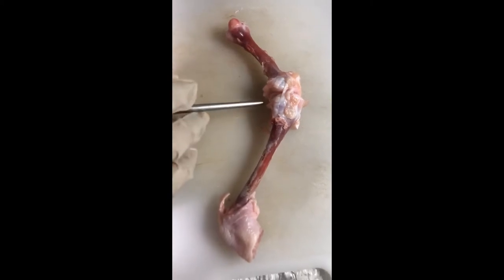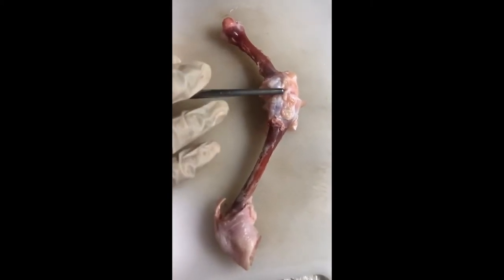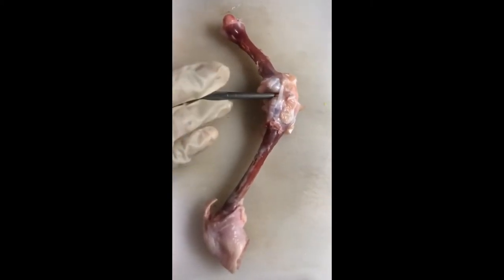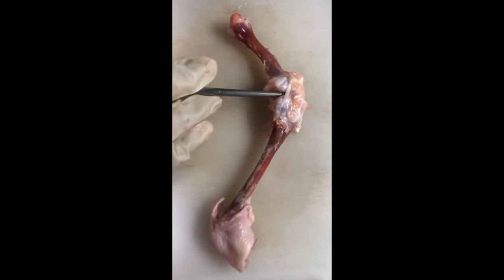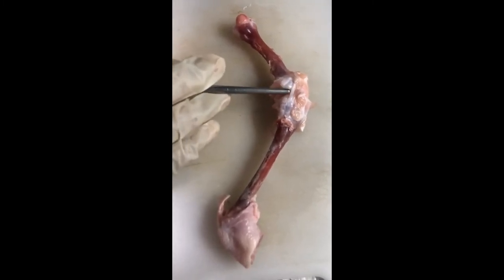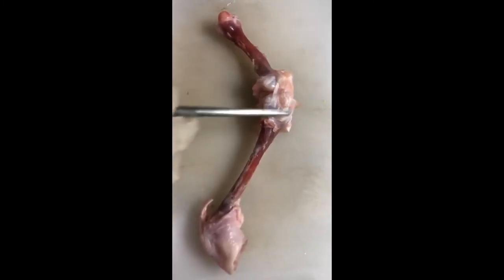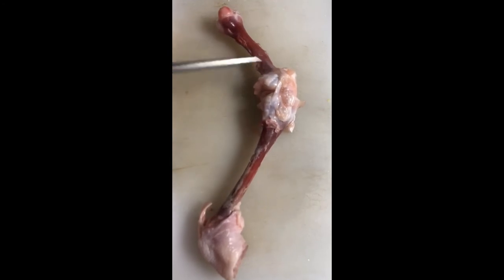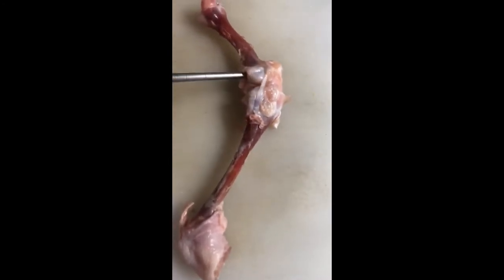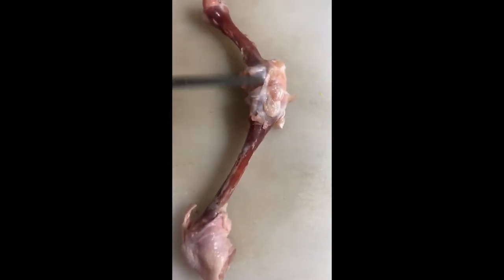Another important connector in our body are ligaments. They are a bit tougher to find on the chicken leg, but you can see some here around the knee joint. Just like ligaments in our body, they connect bone to bone.